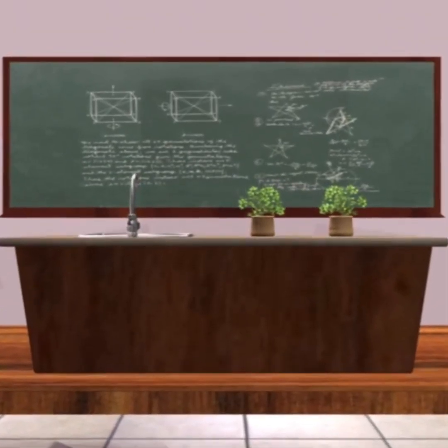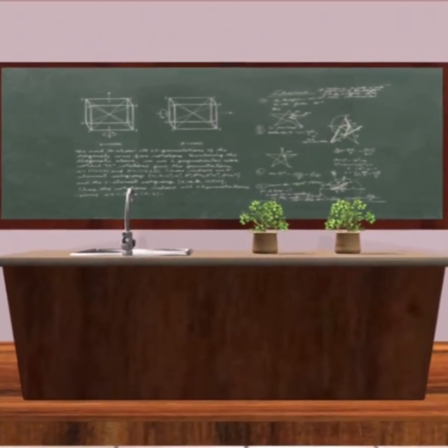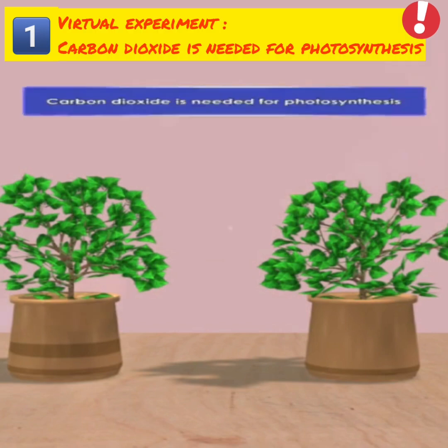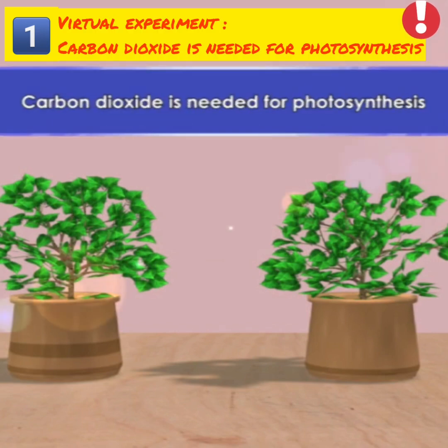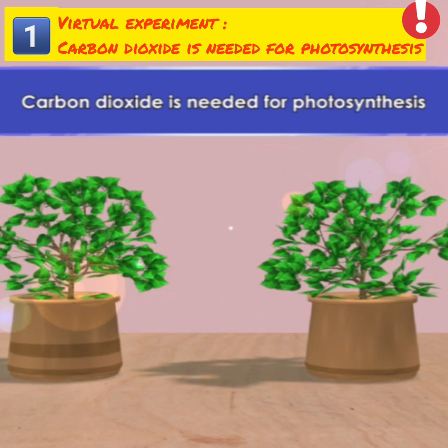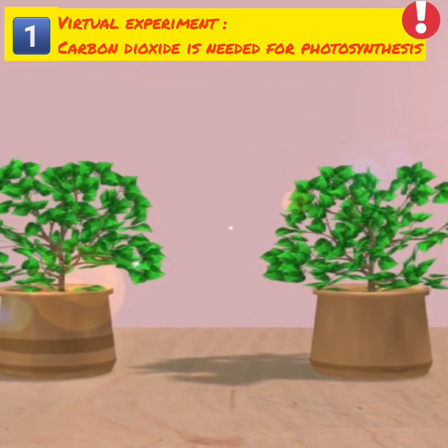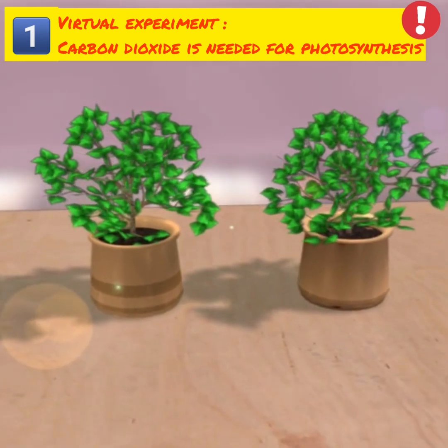The following experiments can show the factors needed for photosynthesis. Carbon dioxide is needed for photosynthesis. This experiment shows that carbon dioxide is needed for photosynthesis.